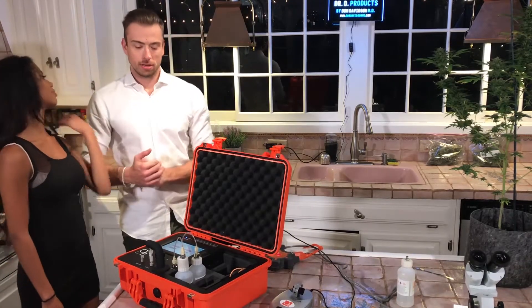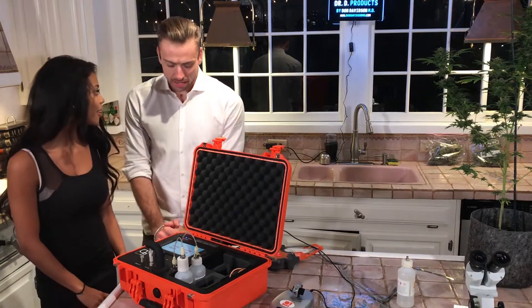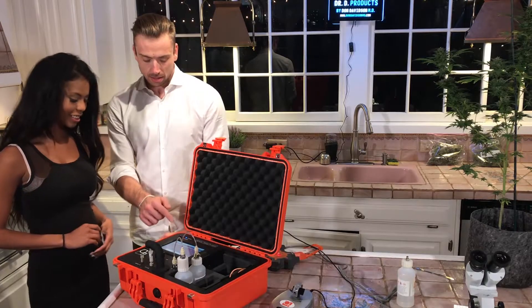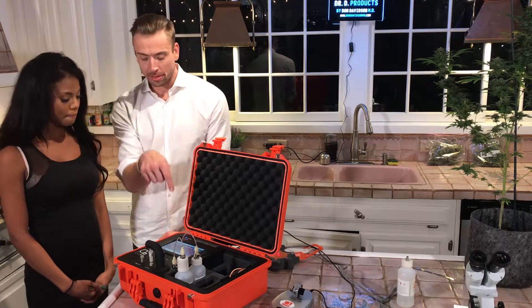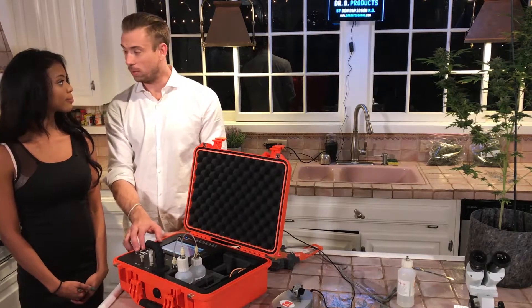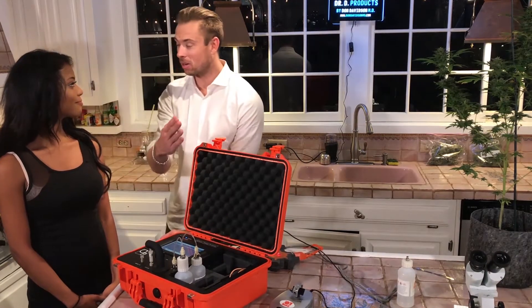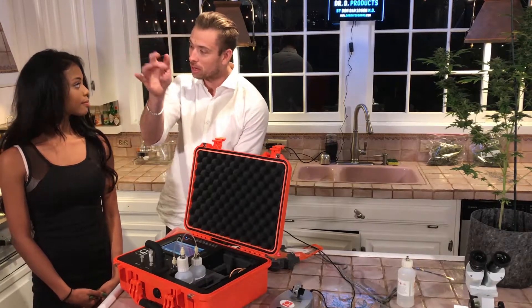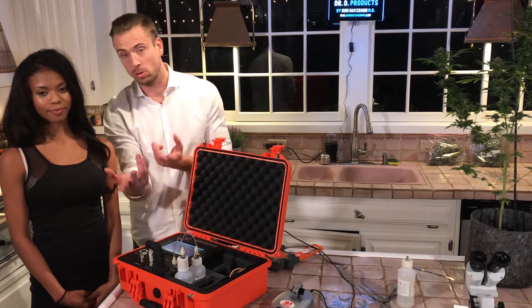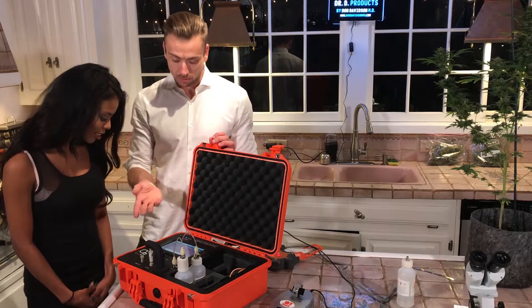We're back after that minute-and-thirty-second cycle. The machine tells you to enter a label for the sample. Go ahead and click the sample ID field. That's going to let you put in a name that gets recorded onto the machine's SD card. The neat part about the Light Lab is every test you run can be tagged with a name, date, or who ran it — stored on the memory chip. So you can track the same plant tested over time, or compare cannabinoid profiles from strains people labeled as sour diesel or whatnot. Let's name this one 'one to one,' because that's what this flower was labeled as.